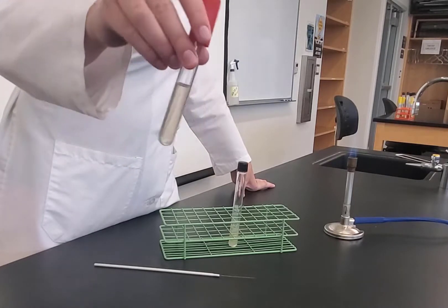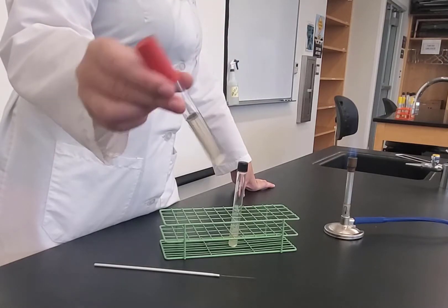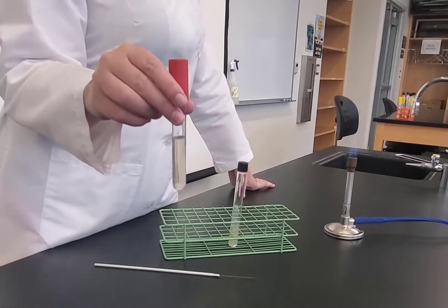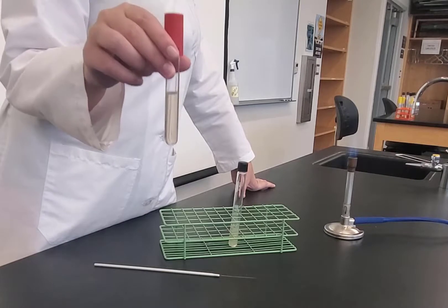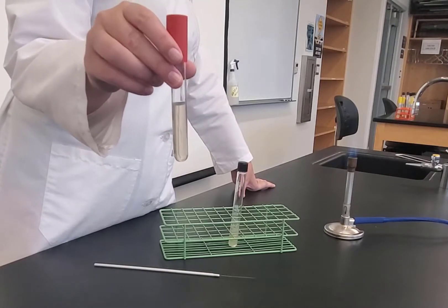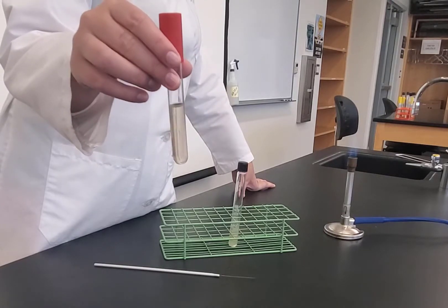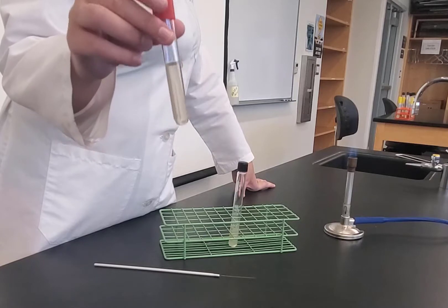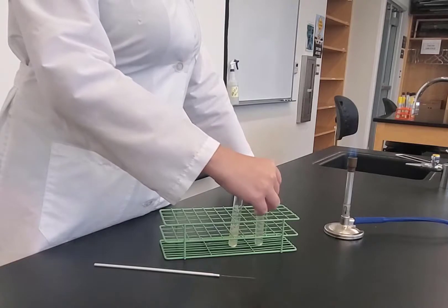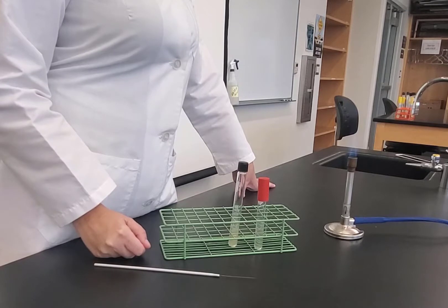Notice that if I look at this motility agar, notice that it's not a broth — it is a semi-solid. And if you recall, when we did our OF test, that was an agar deep. It has a low concentration of agar. Same thing with this motility agar — it has a low concentration of agar. So what that tells us is that we can't inoculate this with a loop. We need to inoculate it with a needle and we're going to do a stab inoculation, just like we did for the OF test.